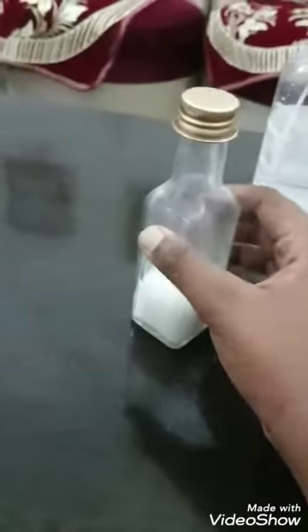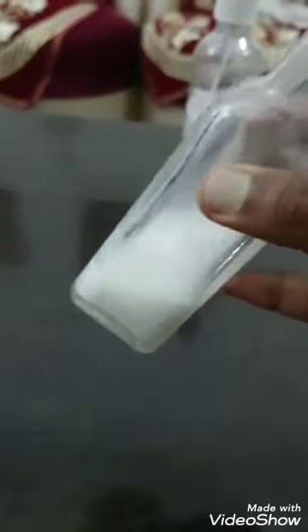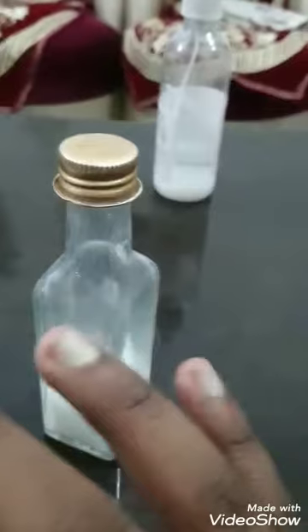If you're doing it in aqueous solution using this ratio, you should see some carbon dioxide bubbles. I did this and got some really good results. If you have done all the things correctly, you should see something like this, something which resembles milk.